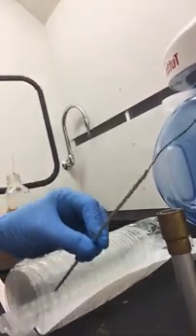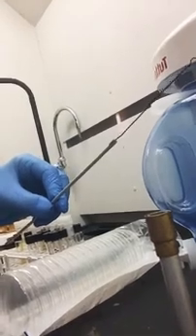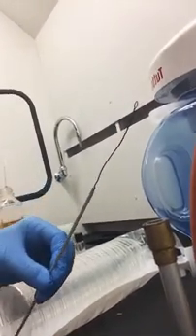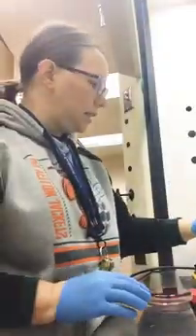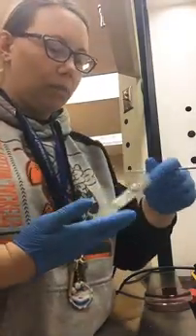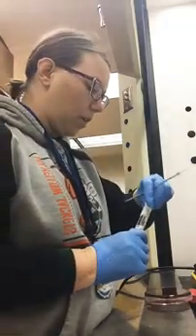And from here, this should be very familiar to you by now because you've been doing this for 15 weeks. You're just going to do an aseptic transfer with your loop. So I'm flaming my loop right now. Doing a complete flame because I just picked it up off the hood surface. So I'm going to get it nice and clean. And then you're going to get a slant for each type, although right now for demonstration purposes I'm using a broth, but you will get a slant tomorrow.